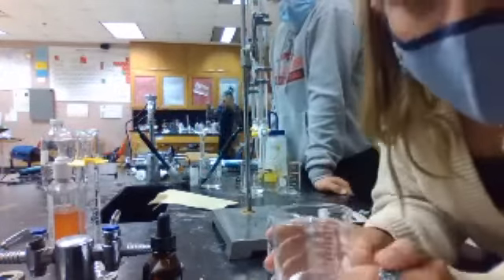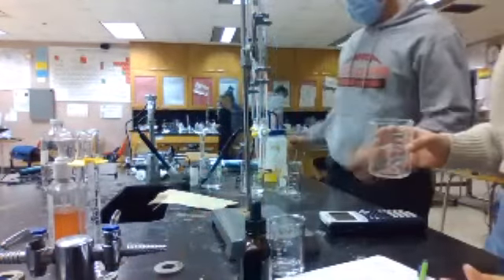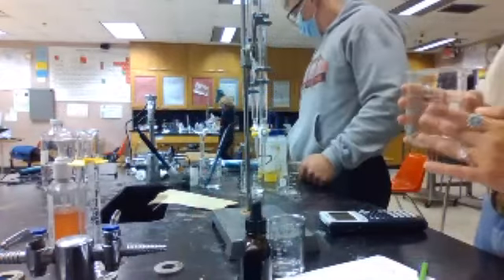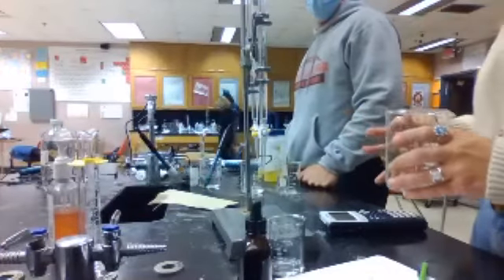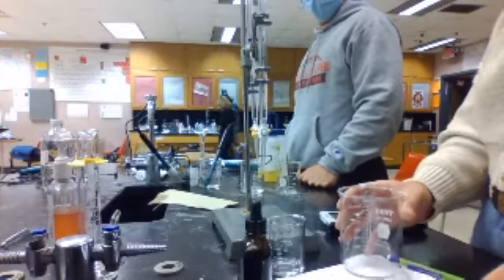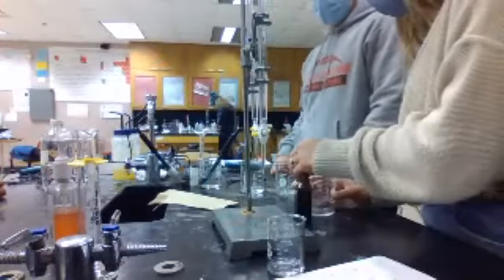So for this one, I think we're actually gonna make the graph. Guys, just go to the main room, because Gavin's the only one in there. Do we have to take the inverse log of the acid again to find the pH? Are you doing the pH trials? Yeah, you just take the pH of that after you add the indicator. So get ready to take the pH, and then he's gonna take the pH each time and yell it to them, after 1 milliliter of base is added each time.